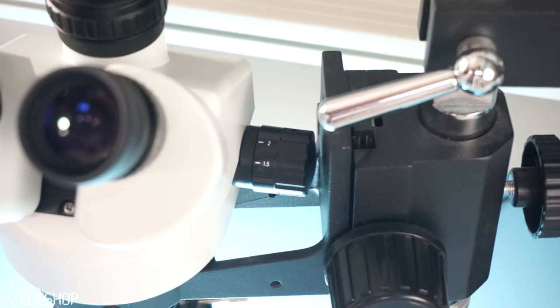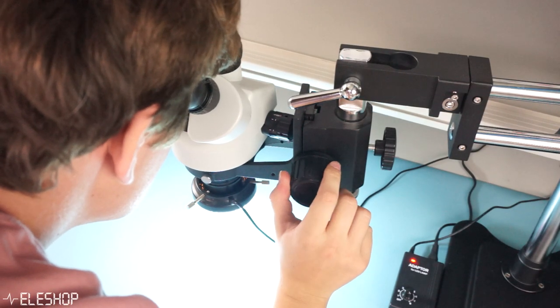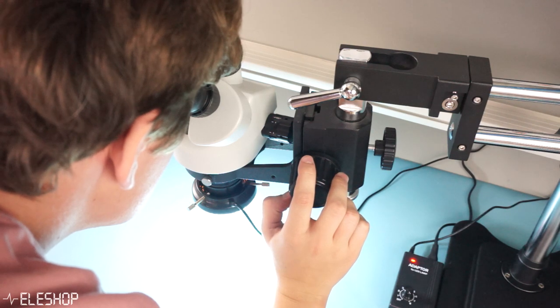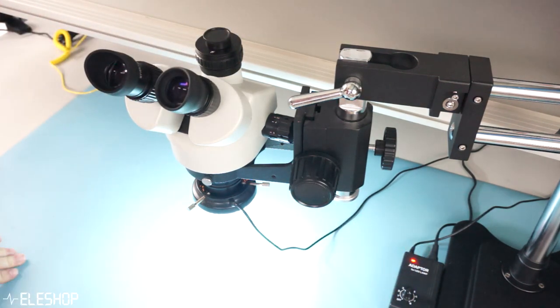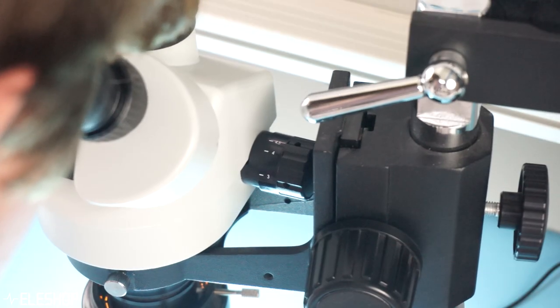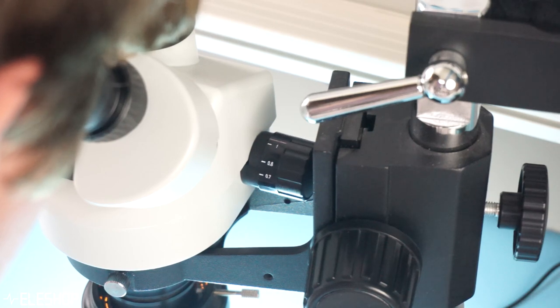Then set the magnification all the way to the highest magnification possible and again bring the image into focus with the focusing knob. Make sure that the object you want to inspect is in the middle of the image. Then adjust the magnification back down to the lowest magnification again.